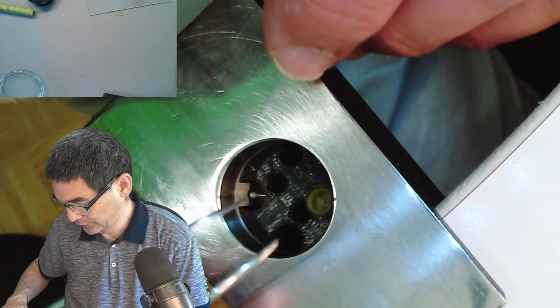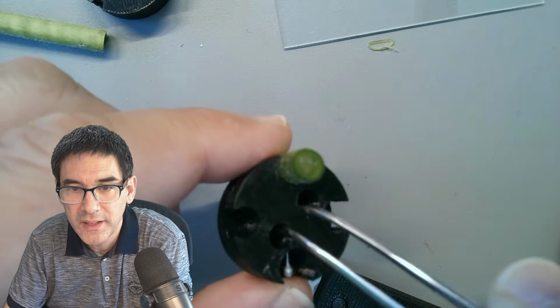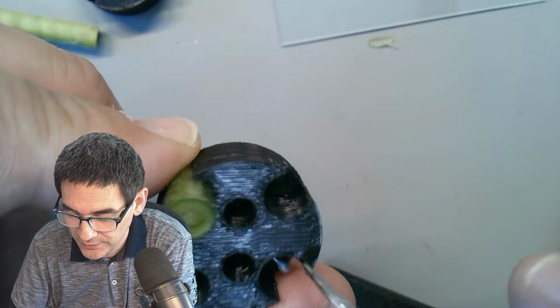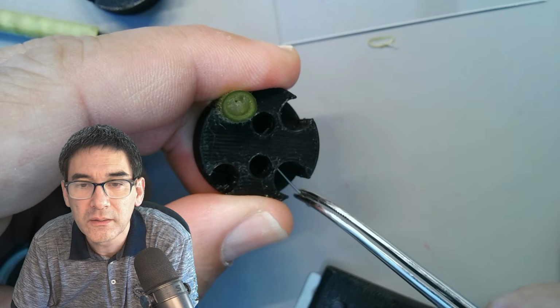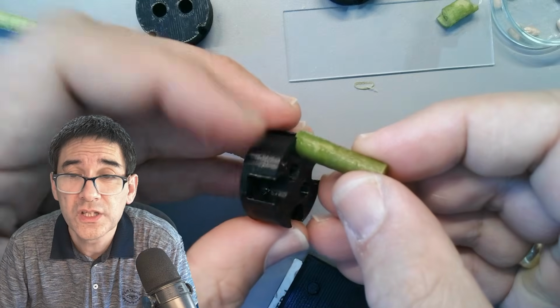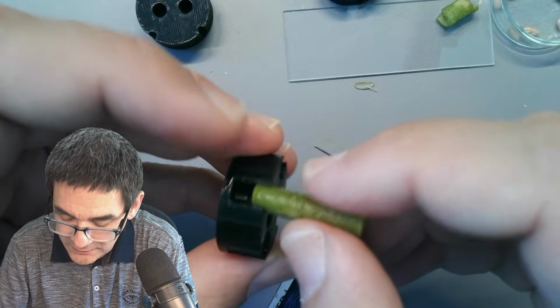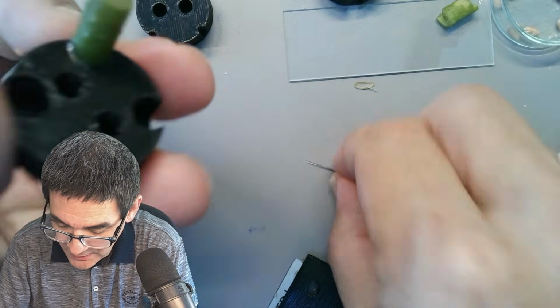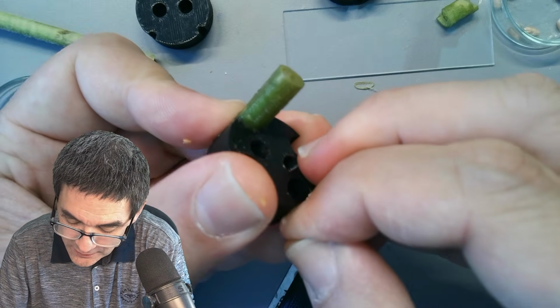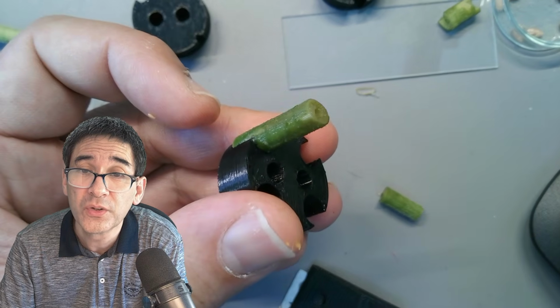But before I do that, I have to remove this here. So let's take it out. You can take it out like this. That's why I made those two holes in here, right? Let's take out the pin, the needle. Here we go. And we can now also remove this here. I just pulled this one out of the freezer. It is not completely frozen, but significantly more solid. So let's quickly try this one before it really starts to thaw, but it is much more solid.